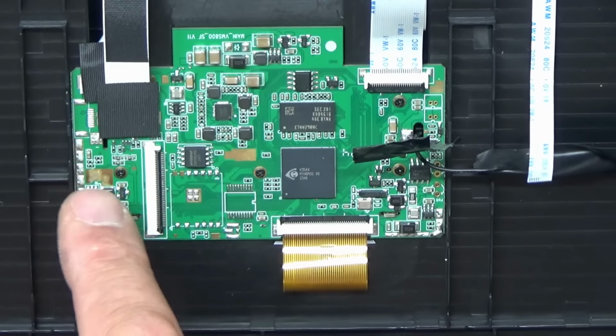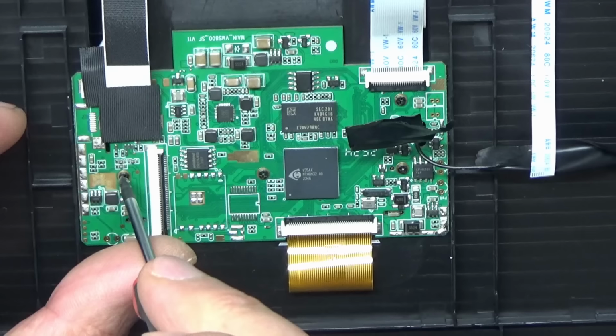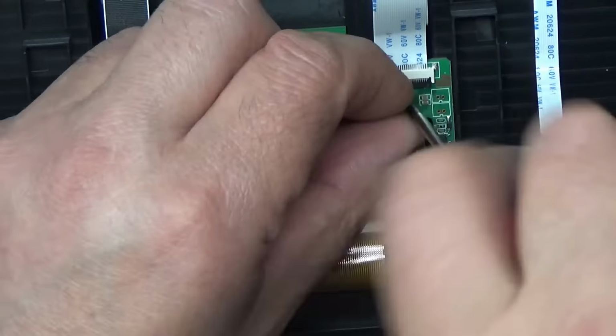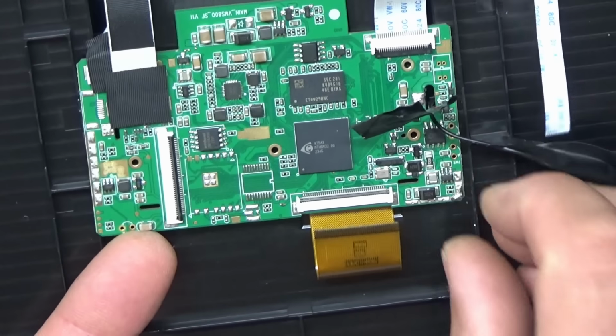So it looks like we need to undo these 4 screws here. We need a smaller screwdriver. Let's try this one. I'm just going to undo this connector. Let's see if I can flip this board over now.